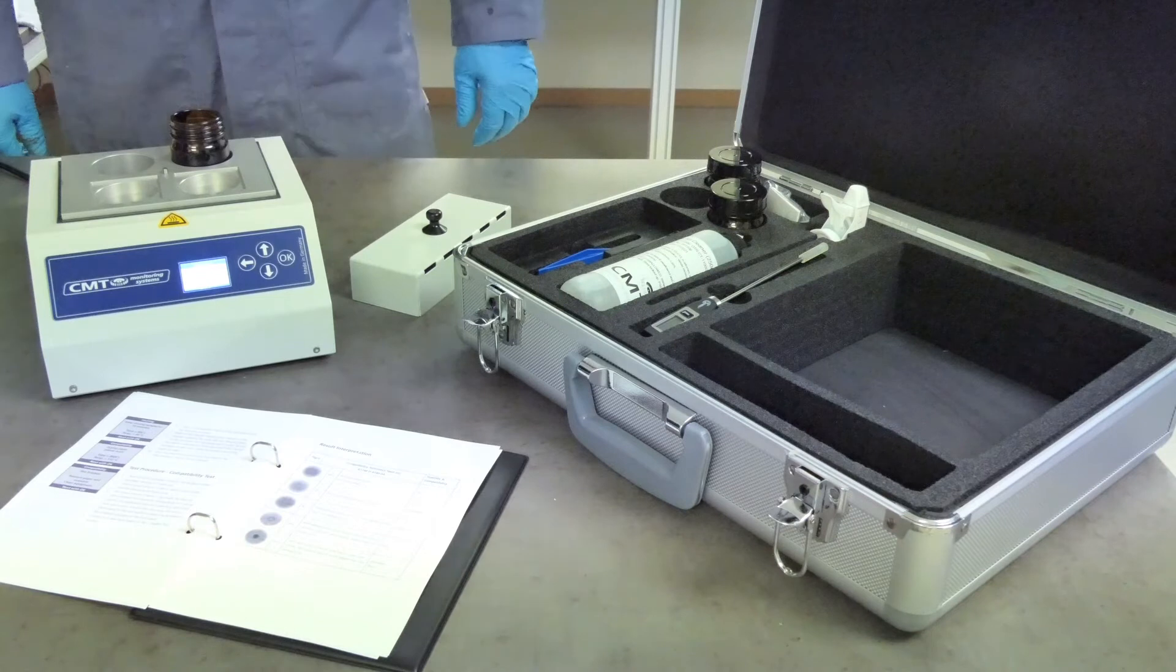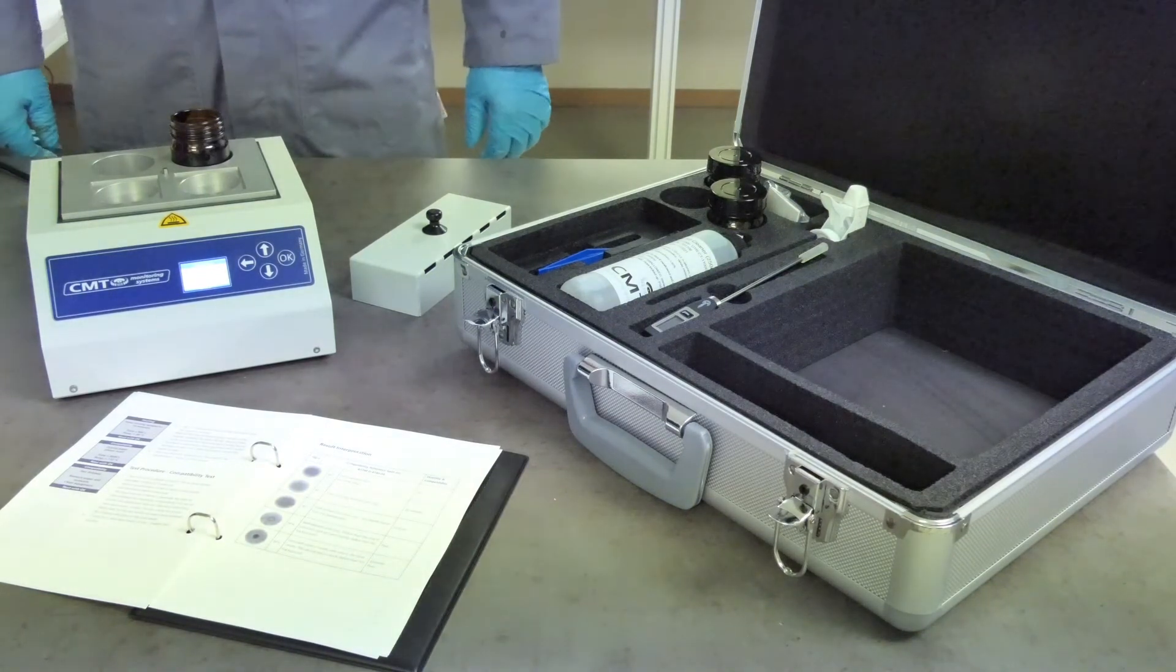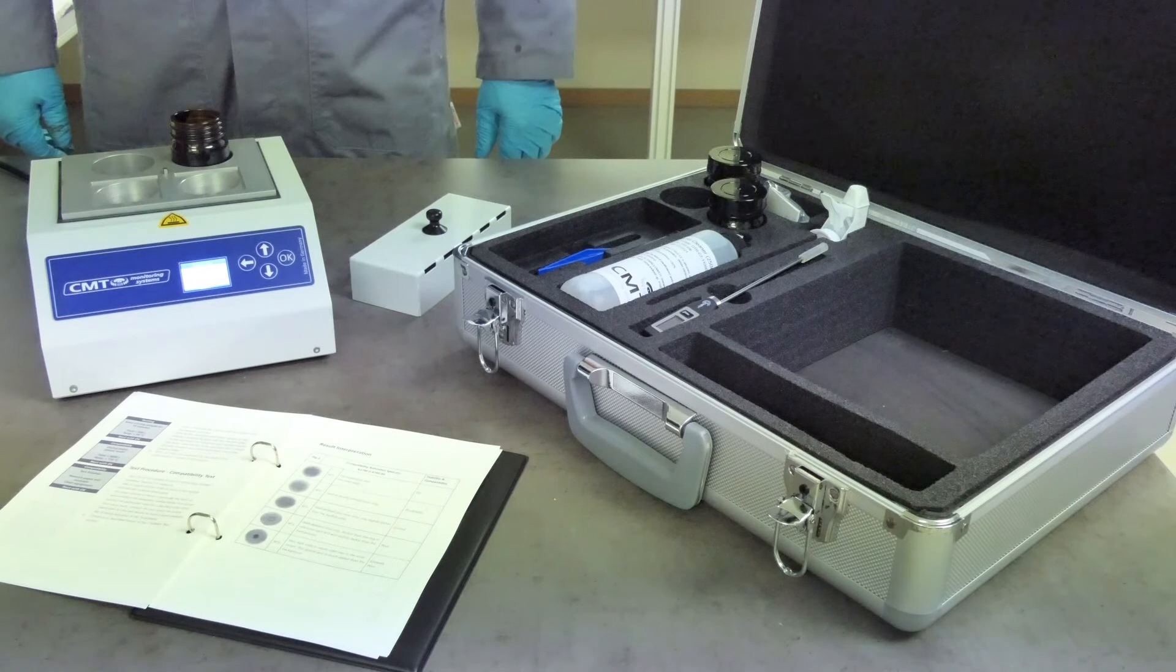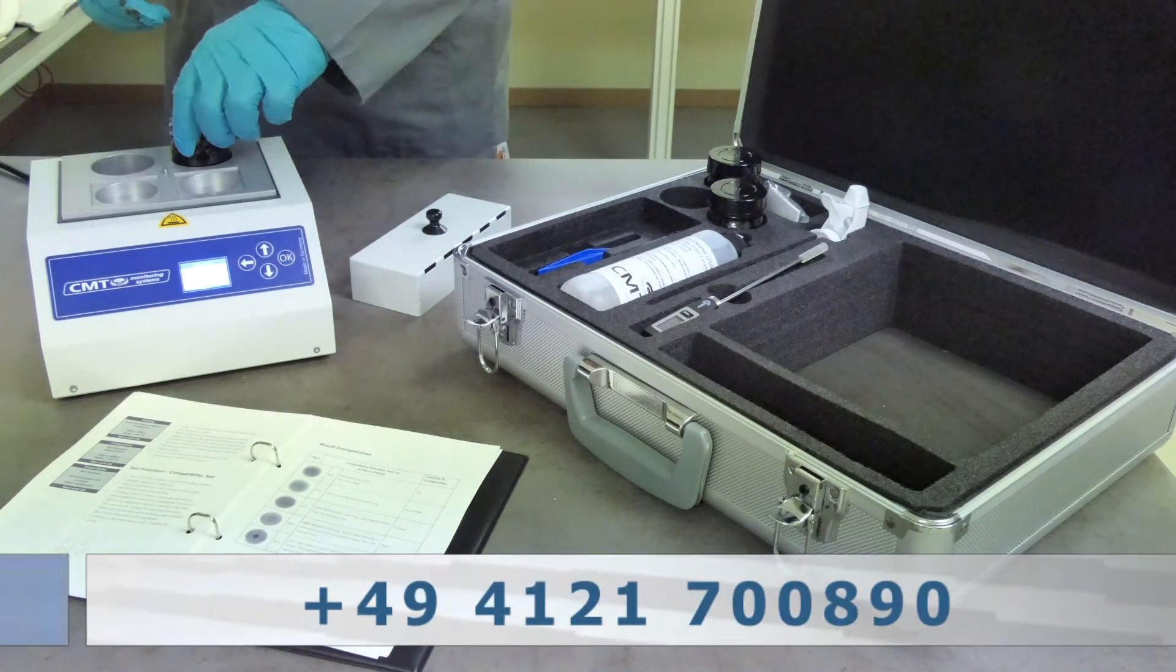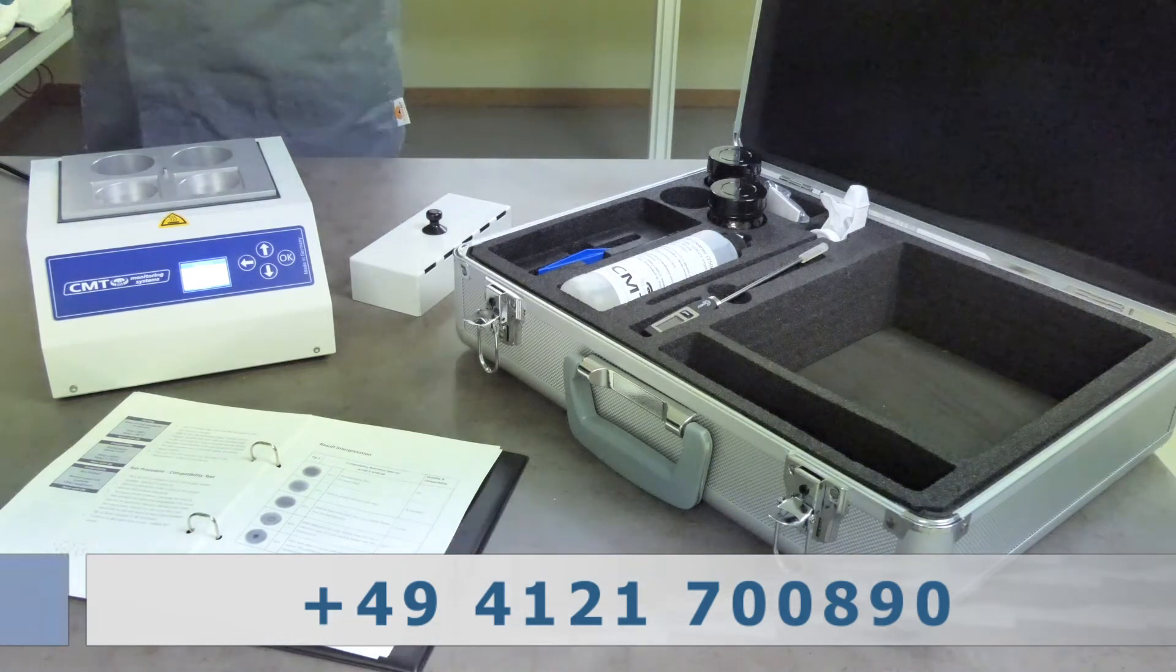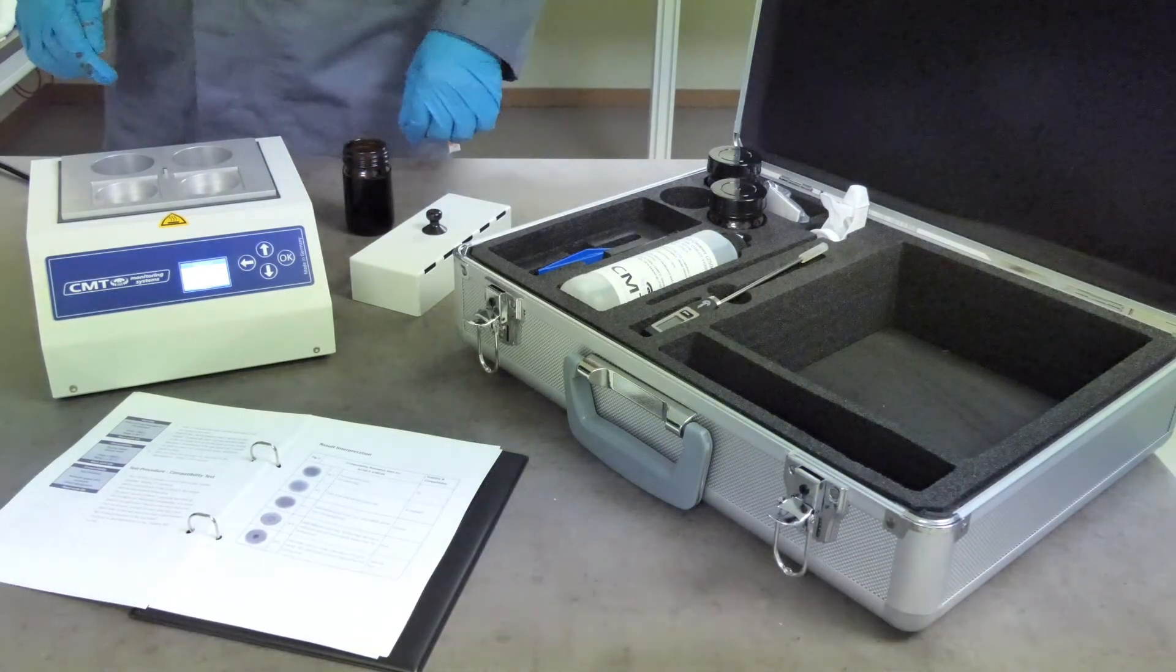After use, clean the equipment as described in the maintenance section of the manual. If you have any problems or questions, please do not hesitate to contact us on the number or email displayed.